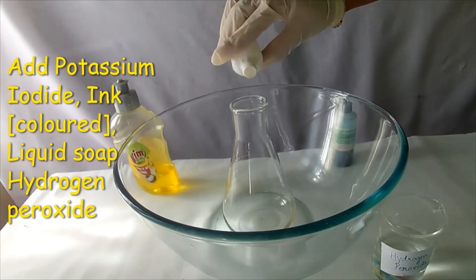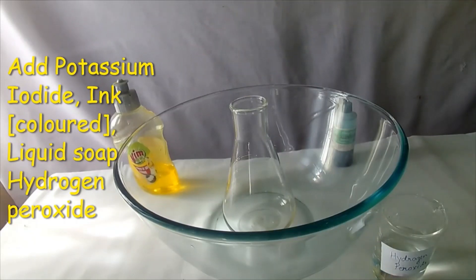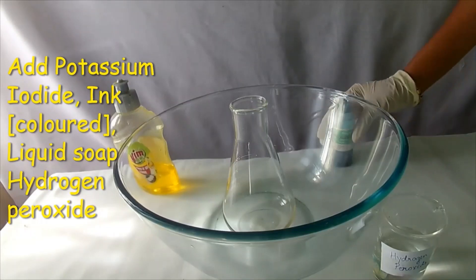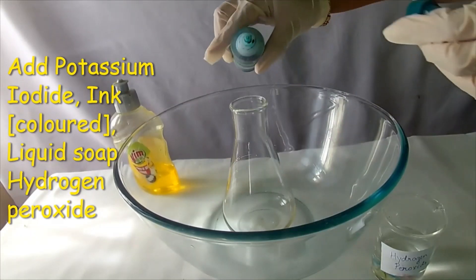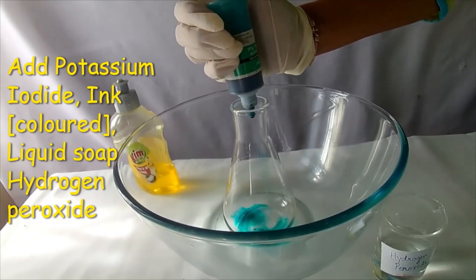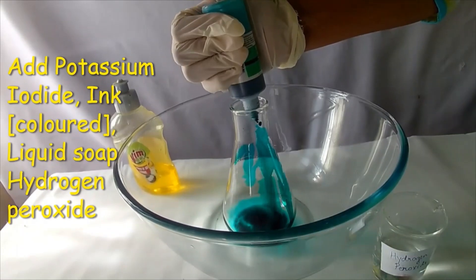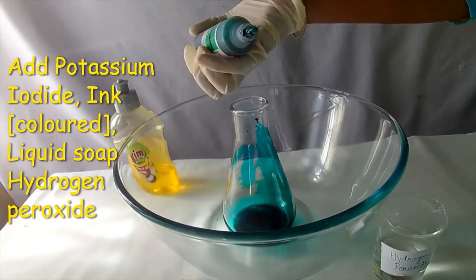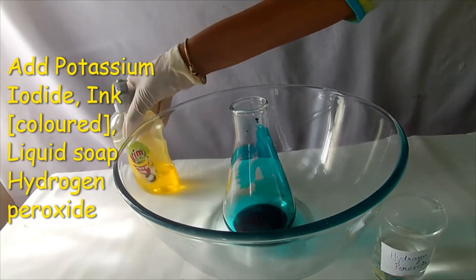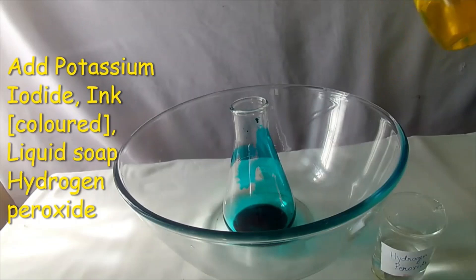Now, add a little potassium iodide into the conical flask. Add a few drops of ink into the conical flask, and then add a few drops of liquid soap.